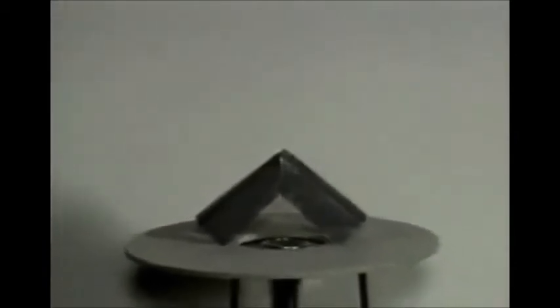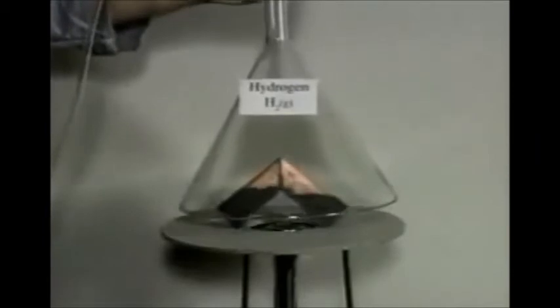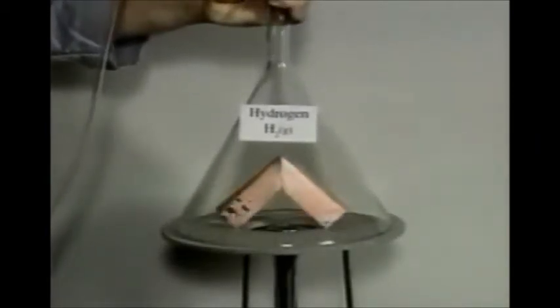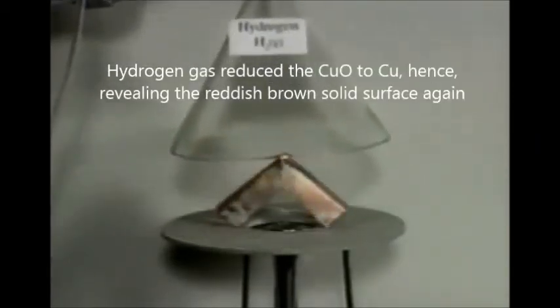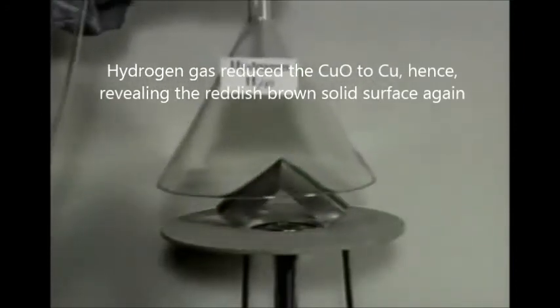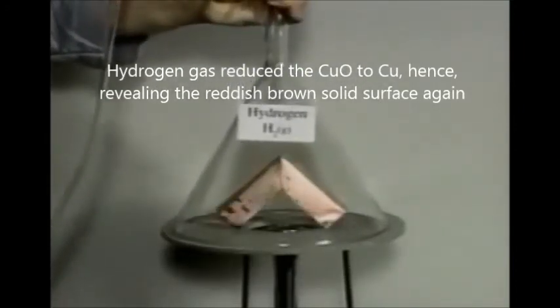The burner flame is turned out, and an inverted funnel with hydrogen gas blowing out of it is placed over the copper. The hydrogen gas is a reducing agent. It reduces the copper oxide on the surface of the copper and causes pure copper to be formed again.